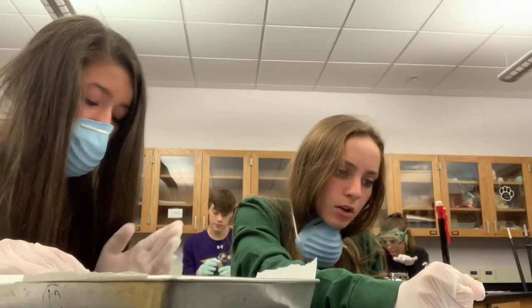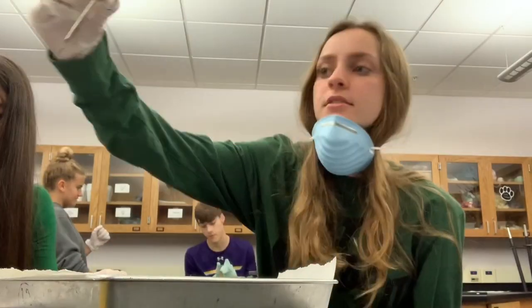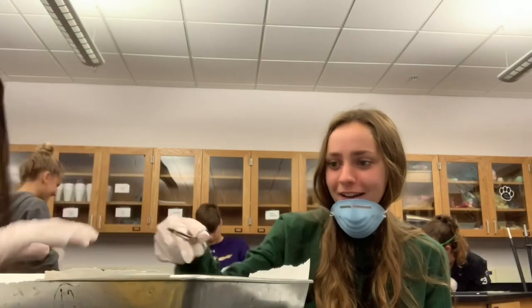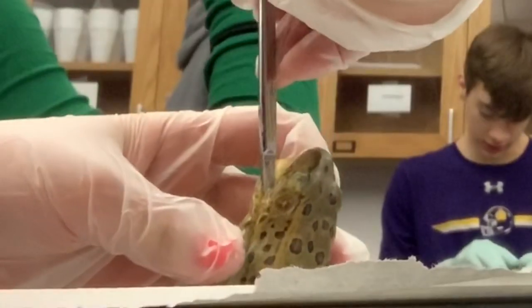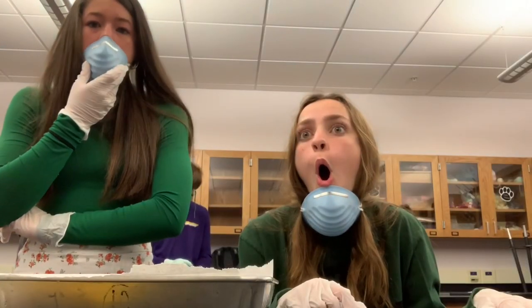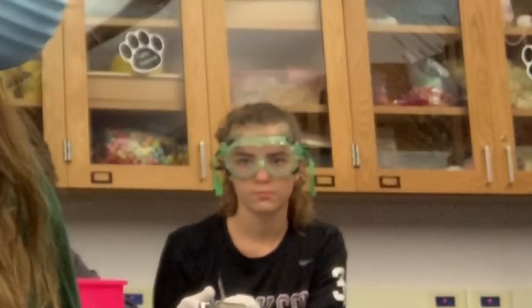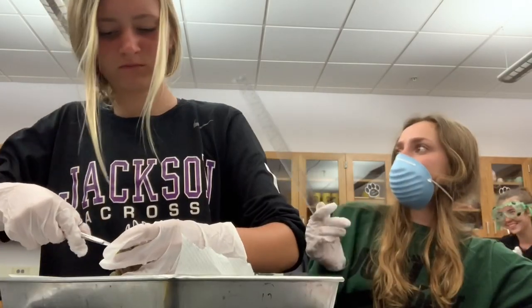Can I take its eyes off now? What? I'm not doing this. You're going to stop the dissections if we can't do this. Miss Owen, she's scaring me. I swear to god — I think it's the tongue being cut off. Oh yeah, it's attached in the front of their mouth. You're pretty cool, dude. Look at you.